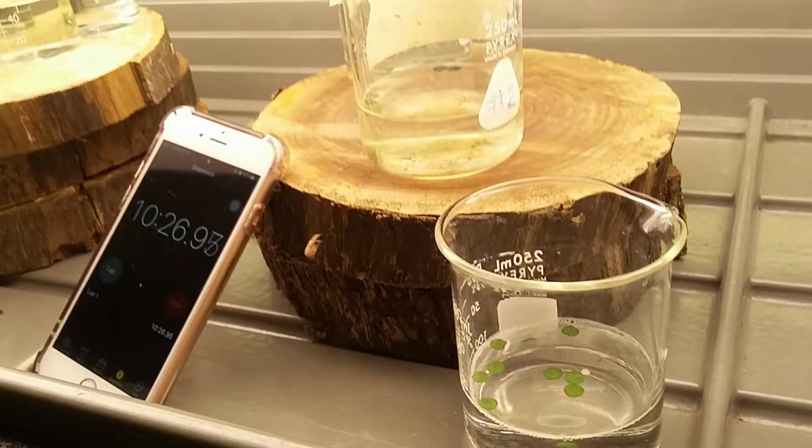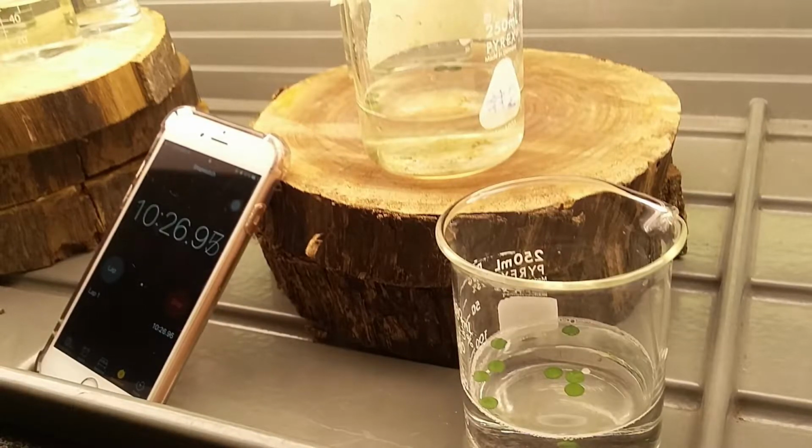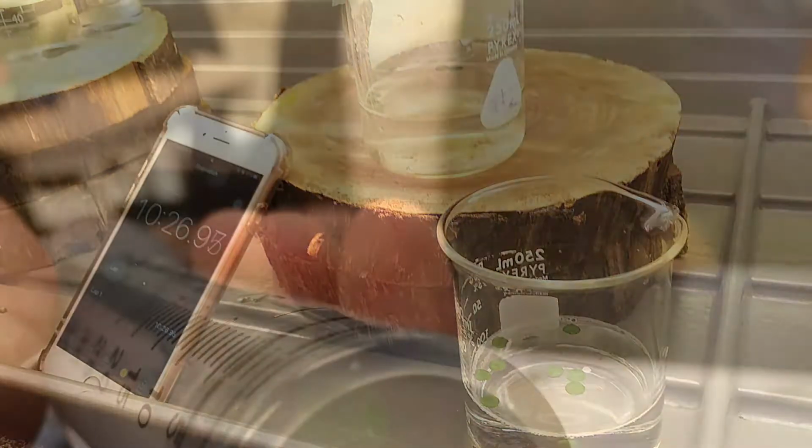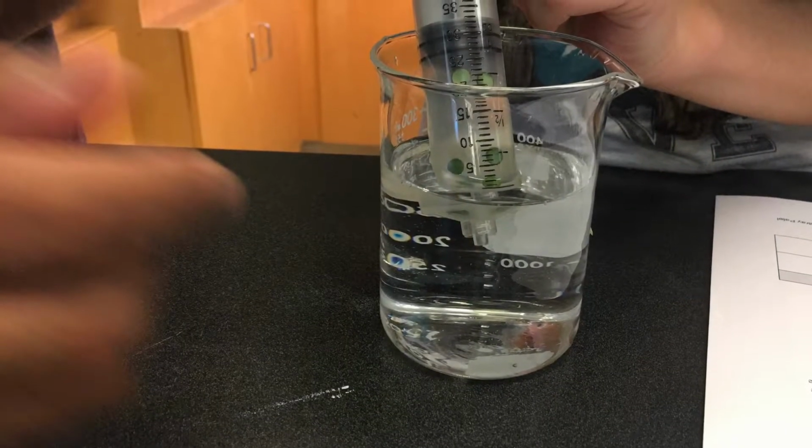This is the reason why the first disc of several trials floated to the top in less than 1 minute from being transferred to the beaker. Once everything is done, conduct a second trial and average results of the two. That will give you the results for your controlled experiment.